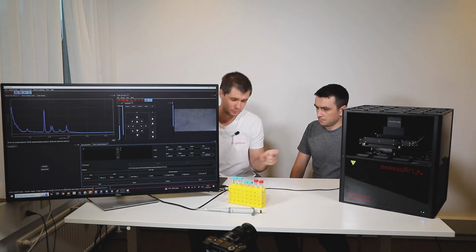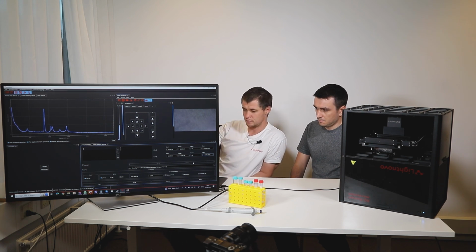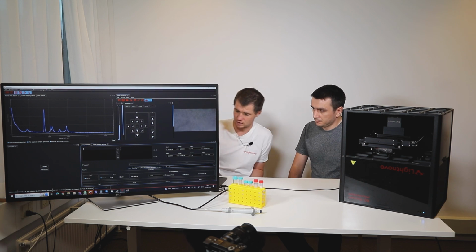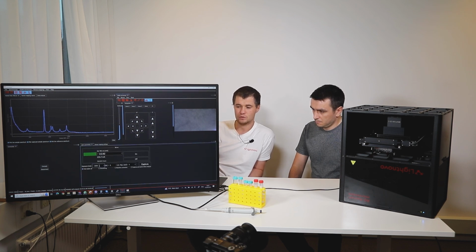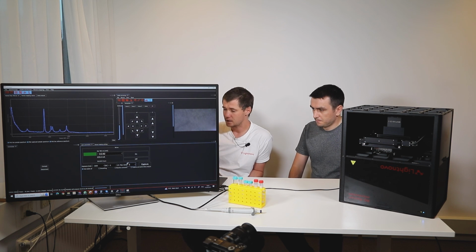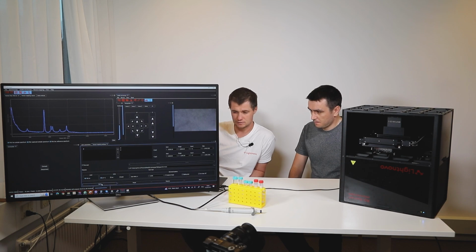So when the distance between wells is set and the number of wells we also agreed, how much we want to map. We set up the file name, let it be quantification, methanol in vodka, 48 multi-well plate, and basically we start mapping. But before that, of course, we want to set some acquisition parameters. Each spectrum we will collect, for example, 3 seconds and maybe 3 repetitions for averaging, it's quantification. And very nice. So starting mapping settings, we press start.